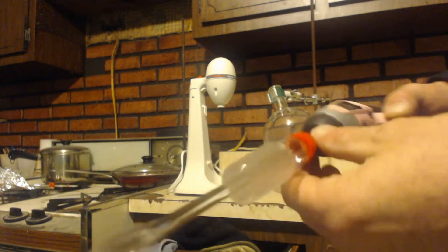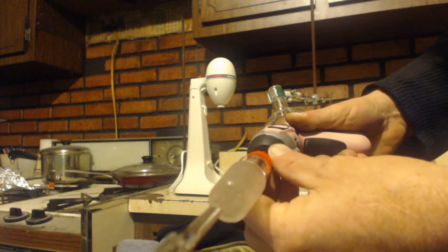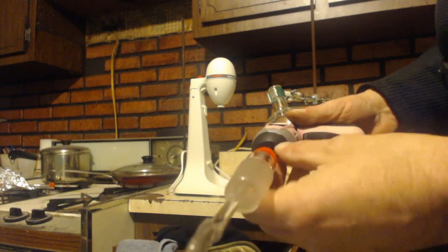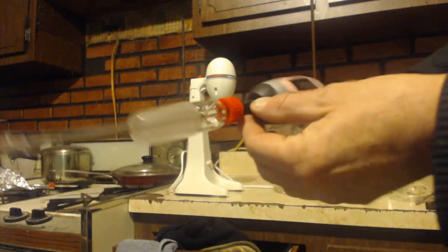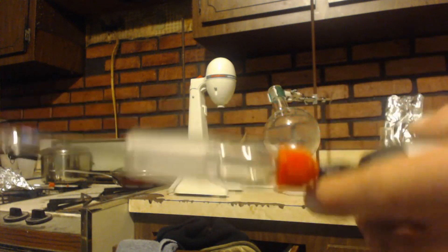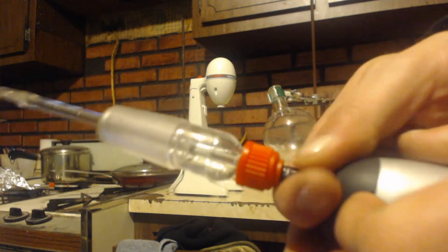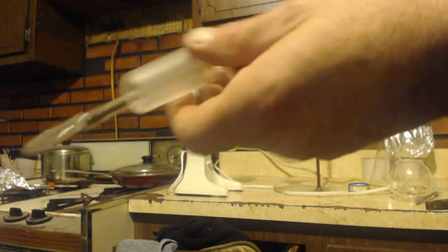Or slightly smaller, so you can put some teflon tape on it, shove it in there, and then use some electrical tape to make sure it doesn't come out.